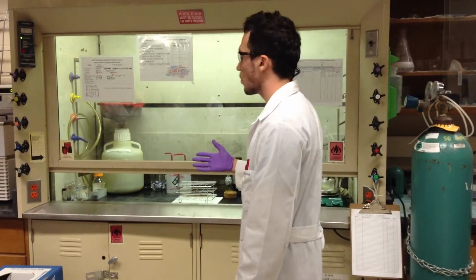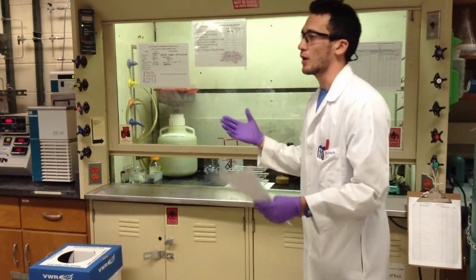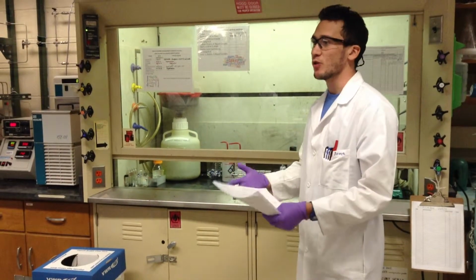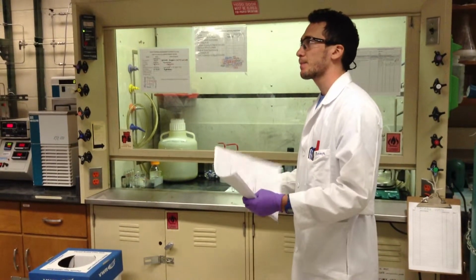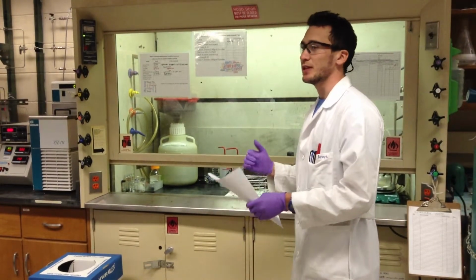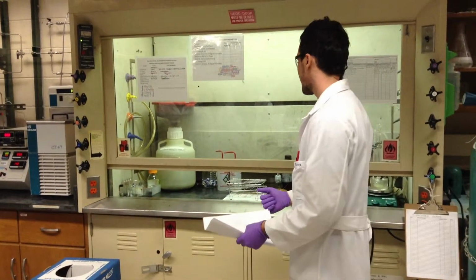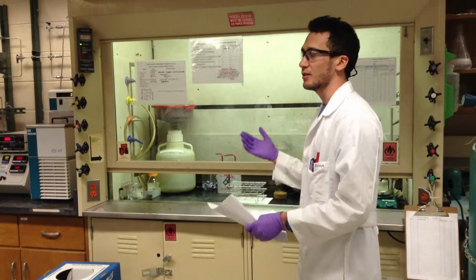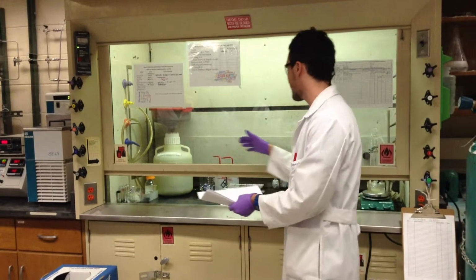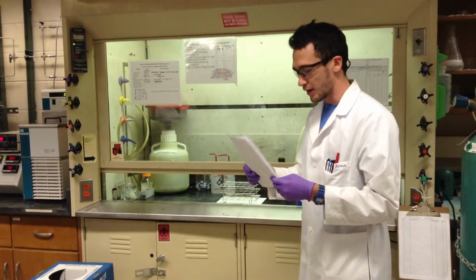There is usually also solid waste. That solid waste is for catalysts, powders, and sometimes people also dispose of paper towels. The reason we do that is because the paper towels get contaminated with chemicals. But try to limit those. When you pick up a mess with paper towels, if it's a dangerous chemical, yes, you have to dispose of it there. But try to limit the amount of paper towels you use, because that container is really tiny. So yeah, be careful with that.